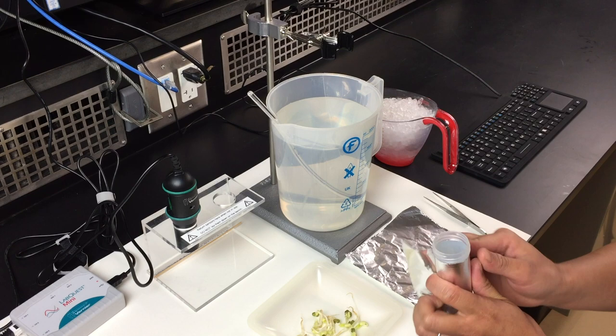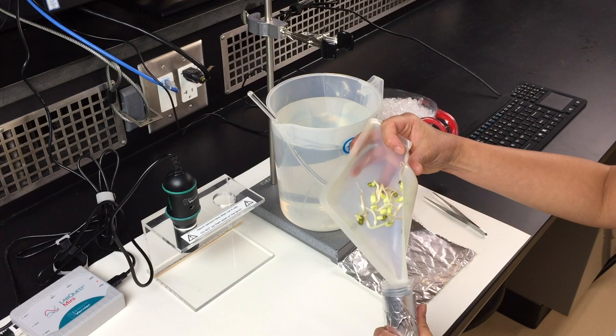Wrap your biochamber in foil and transfer your mung beans into the biochamber.